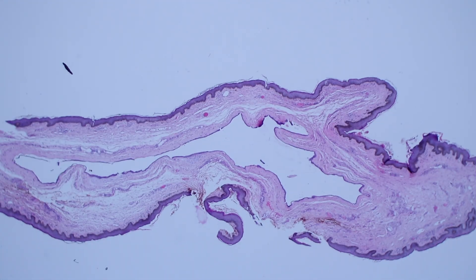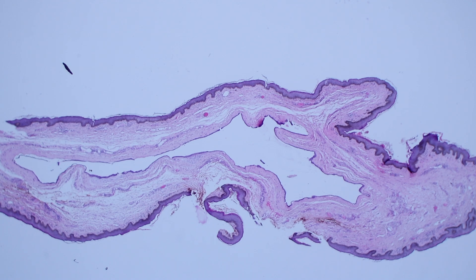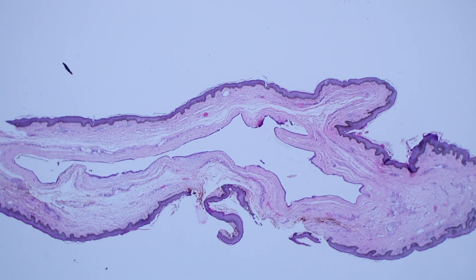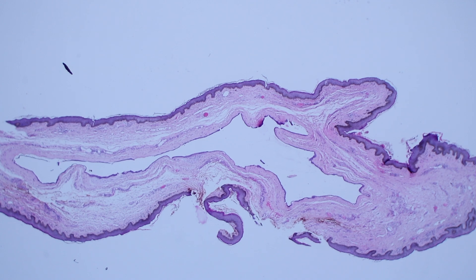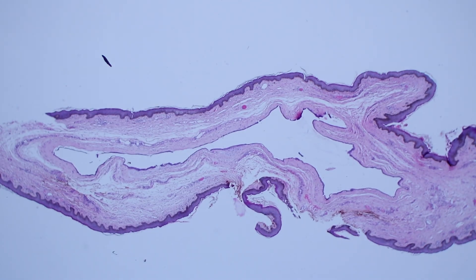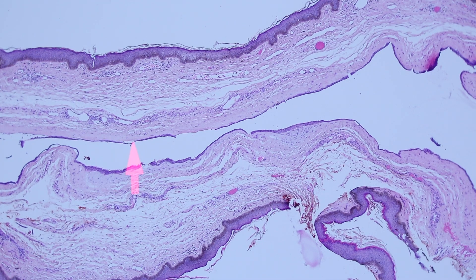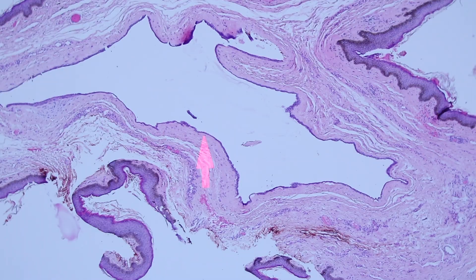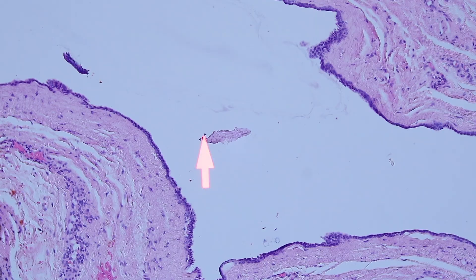Here is yet another type of cyst. This was a shave biopsy of a kind of bluish or translucent looking papule on the eyelid. You can see there's this large space in the dermis — a space that is open and doesn't really have much in it. If it had any contents, they were probably washed away during processing. Let's come and look at the lining.